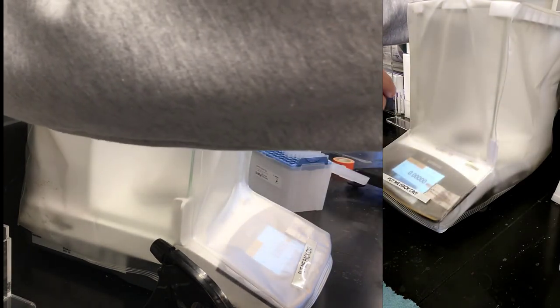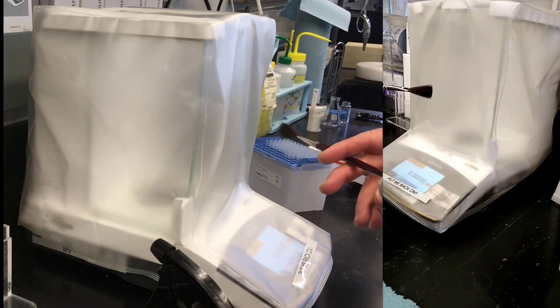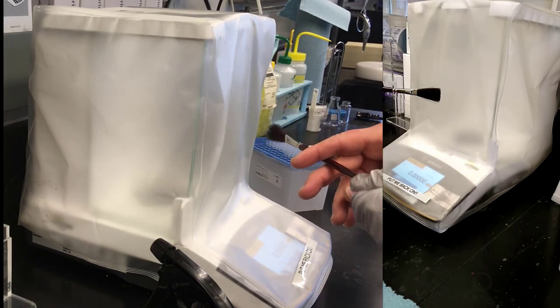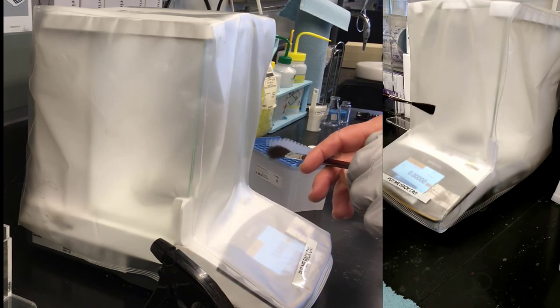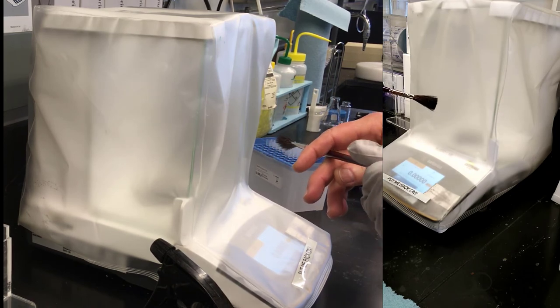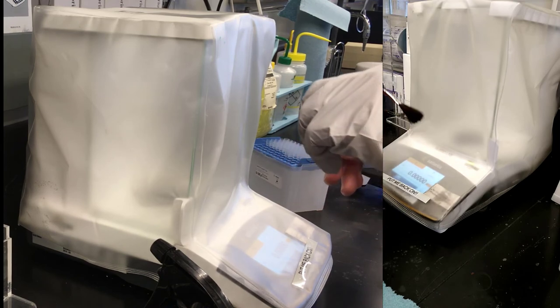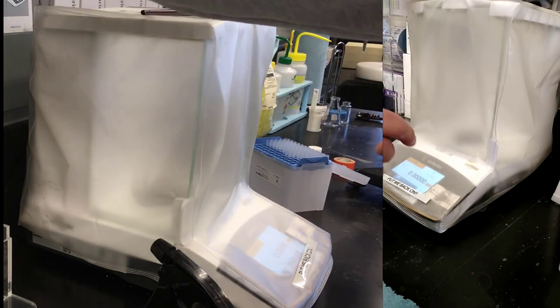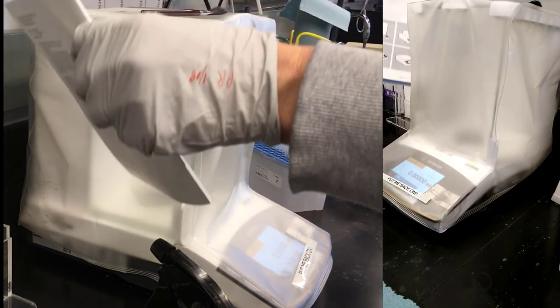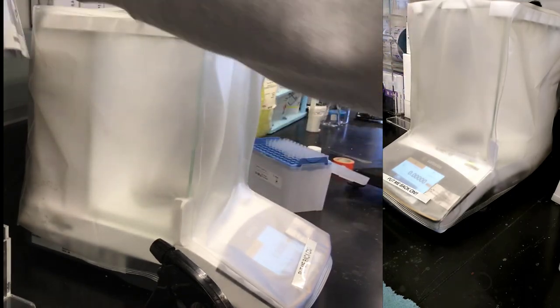Now, there's one other thing that I didn't show you. If you come to the balance and it's dirty, you can brush the powder off of the surface of it. If it's more than that, then you want to come get me or somebody else who really knows the balance. This camel hair brush can sit up there. And then right behind it, we have the Sartorius user's manual. And that can be helpful.